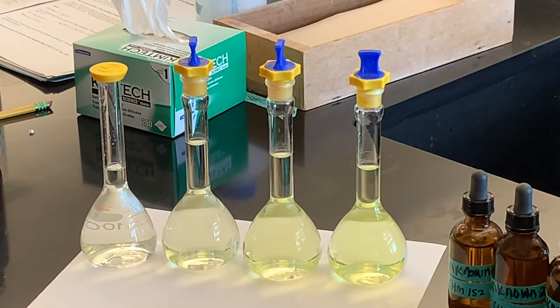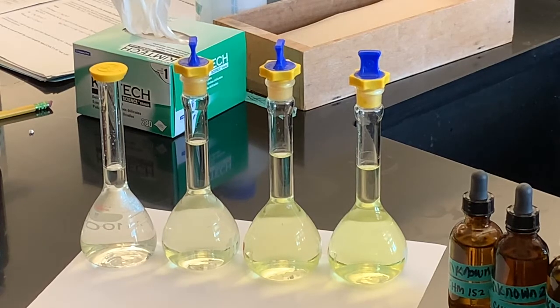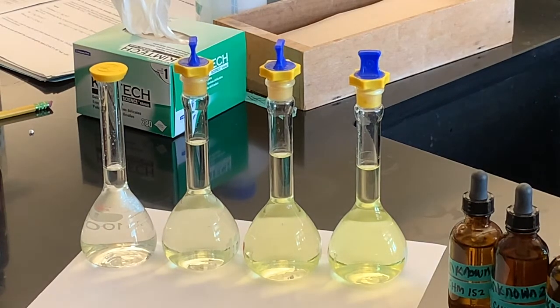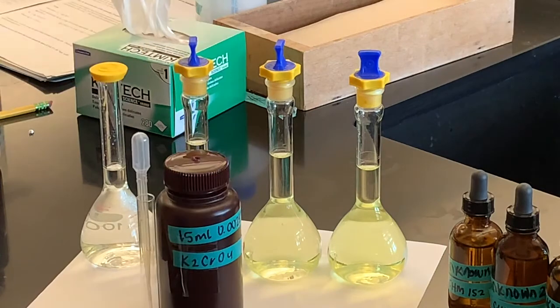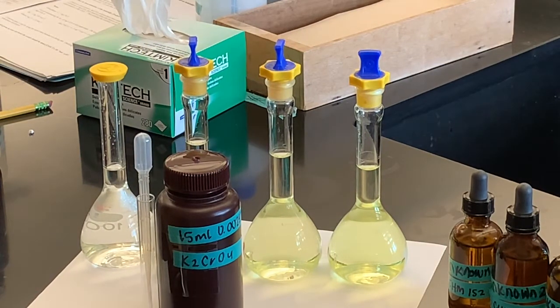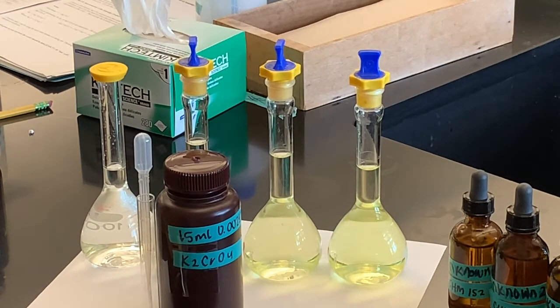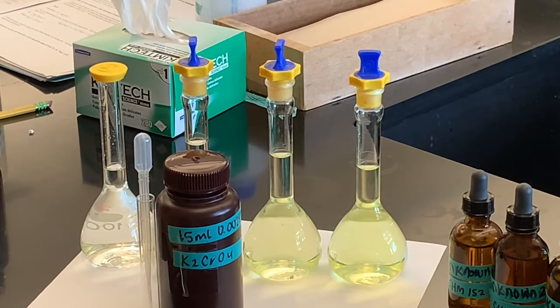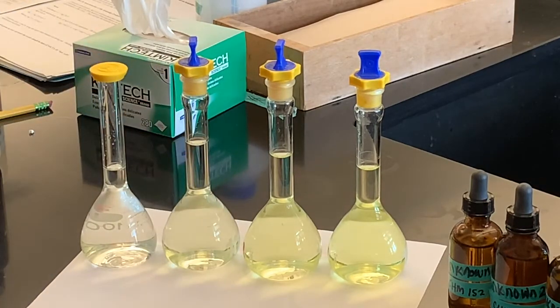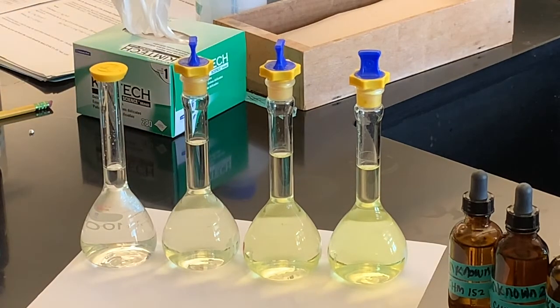Next, I'm going to transfer the solutions into different bottles so they're easier to handle and to get into the cuvettes for the Spec 20.